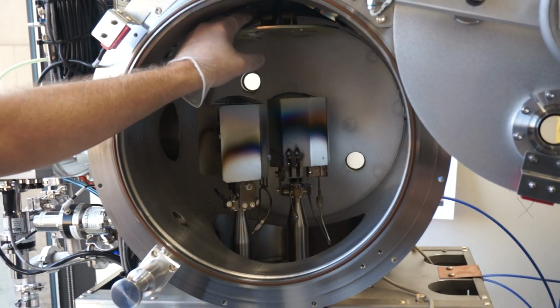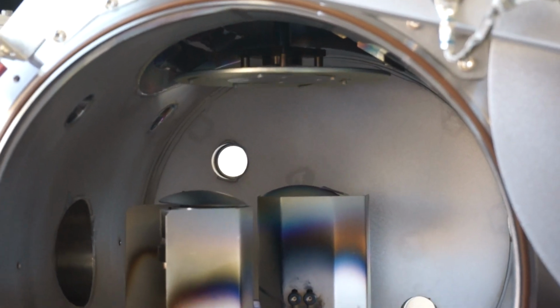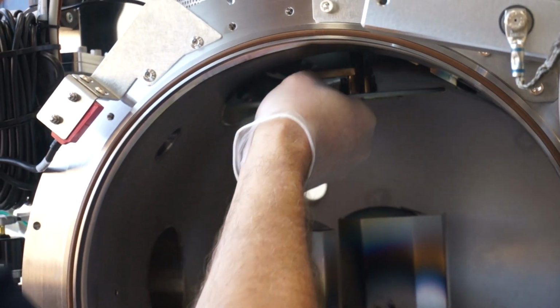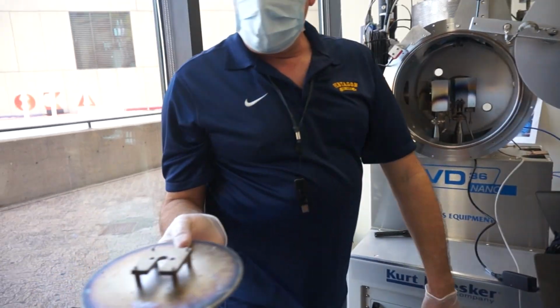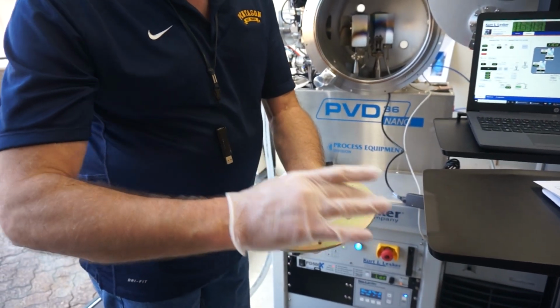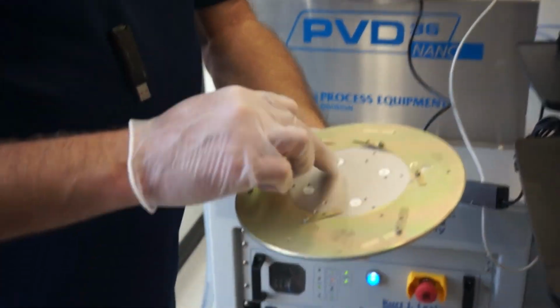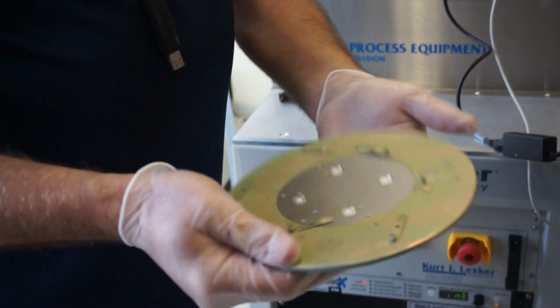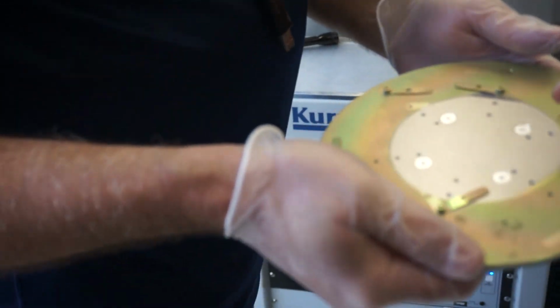So you notice how this is cut out right here? I want that cut out to face the 12 o'clock position. So if I can just take this like this and bring it back, this just rests on these two pins here. It's a multi-site holder. So you'll notice there's a cascading bolt pattern around where these clips go. You can use wafers, slides, whatever you want, and mount those to the front surface of this. We use the 4-inch wafer whenever we ran the test.